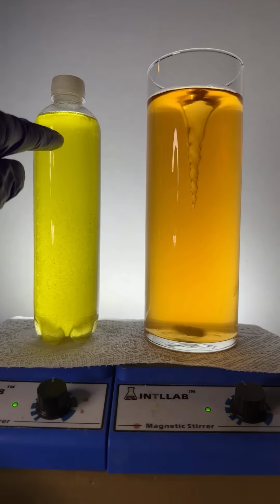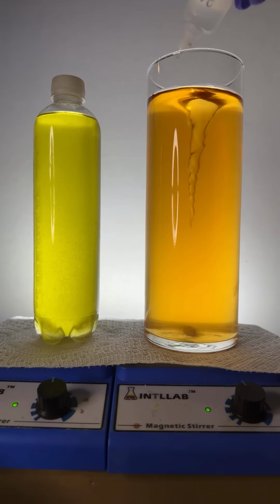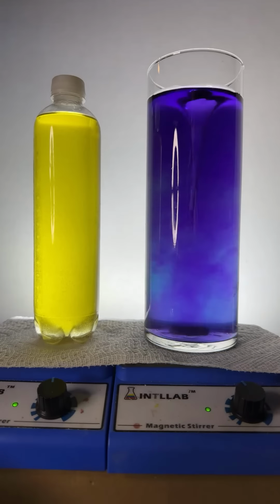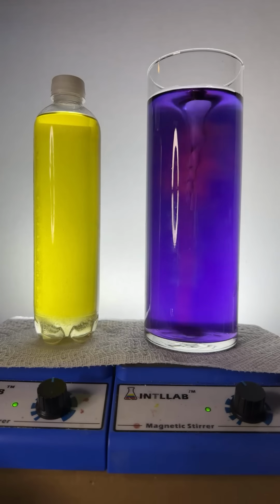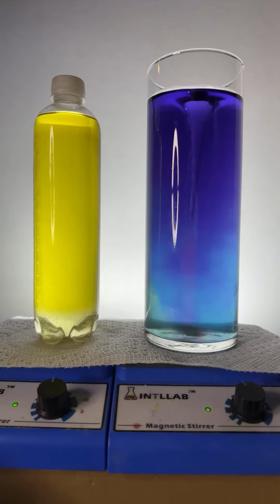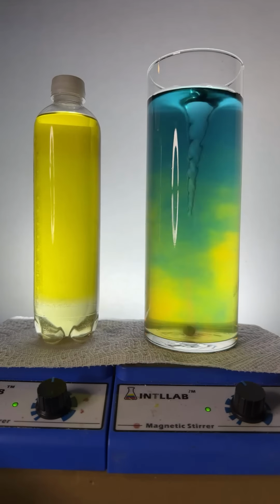Now, just like I can change this dye's color by adding base, which you'll see me doing here, I'm adding a little bit of base. And now over here on the right, I'm going to add a little bit of acid, and you'll see that the dye is changing color when I do that. We're going to try doing that over here. I'm going to just start adding acid or base to this stuff. The reason you see the color changing is because this is an acid-base indicator, and that acid-base indicator changes color depending upon pH.